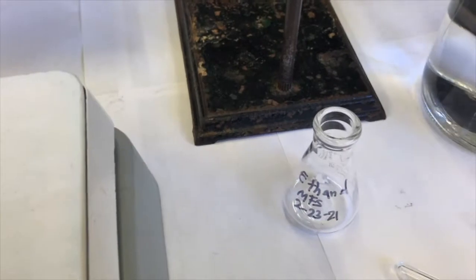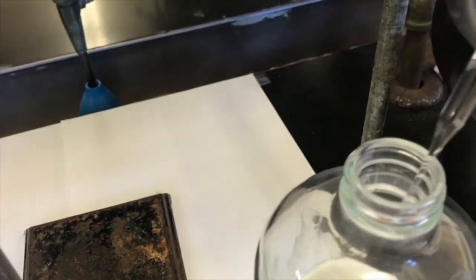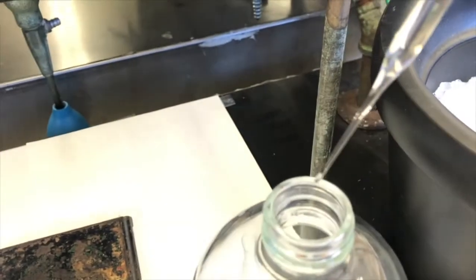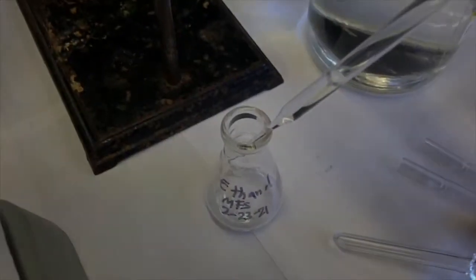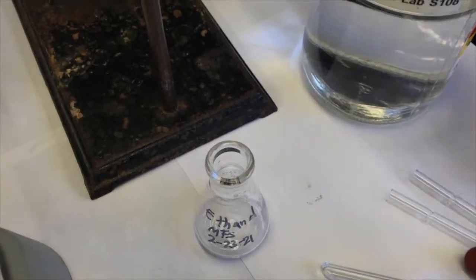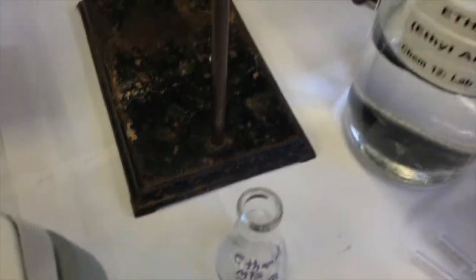Okay, so back over to our flask. So how should I add my ethanol to this? I want to add about 15 milliliters. That should be enough for this crystallization. How do I do it? I could get the pipette and draw some up and see if it drips. It's not too drippy. Oh, it's looking good. I'm going to spit it out anyway, so sometimes it starts dripping on you if you don't. Draw some up, dispense it, draw some up. Evaporatively cool that pipette. Okay, I got a little bit of ethanol. So I'm going to keep going until I get to 15 milliliters. This is going to take a little while because this pipette only puts less than a milliliter at a time.